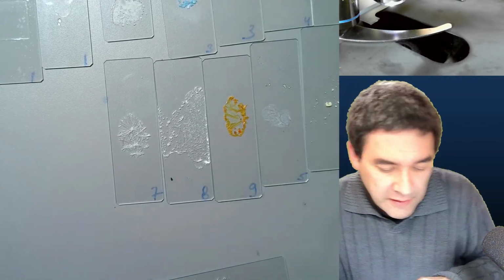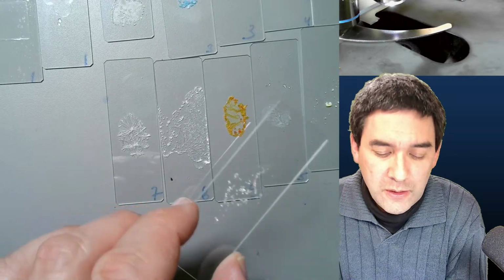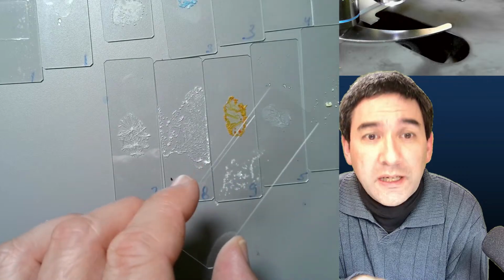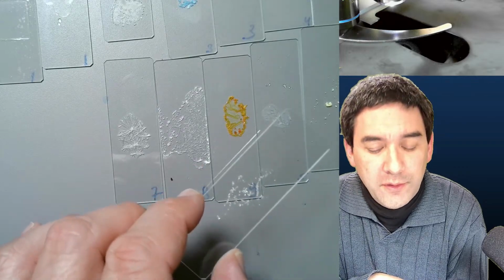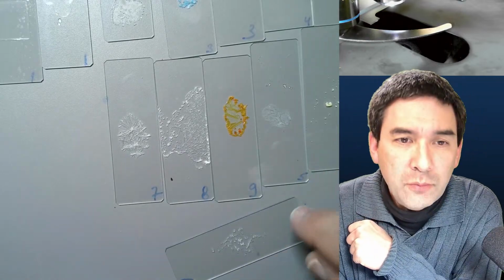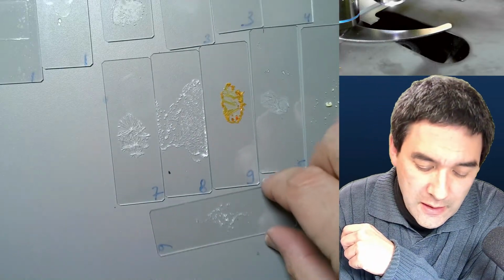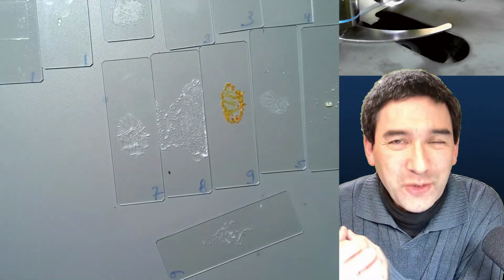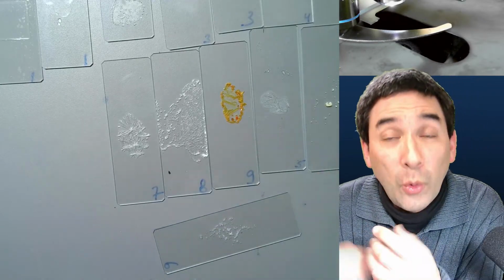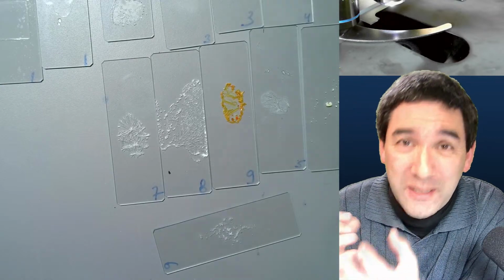Okay. So I've got here a substance called aluminum sulfate, and because the crystals are very delicate, I would like to protect them a little bit. The question is now, how do you do that? Well, it's very clear that I cannot put mounting medium. Normally you would put mounting medium on the slide, and then put a cover glass on top. This is not going to work, because many mounting media are going to dissolve the crystals, or the refractive index between the crystals and the mounting medium is not right, and then you don't see them properly, right?